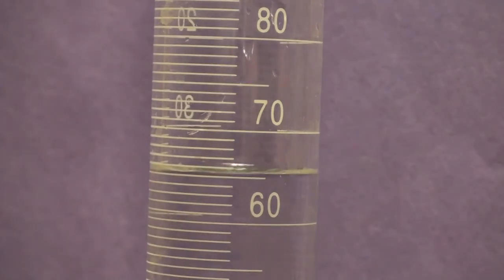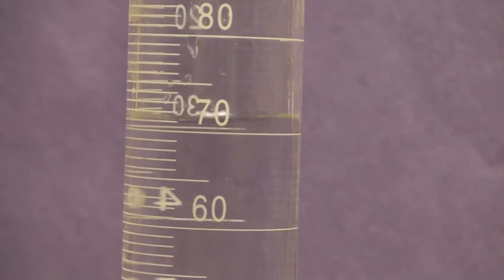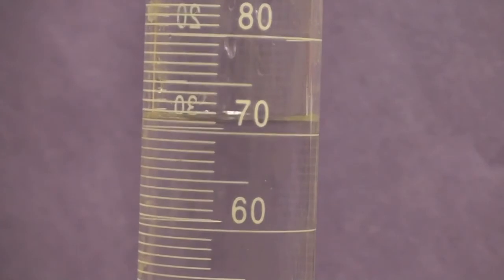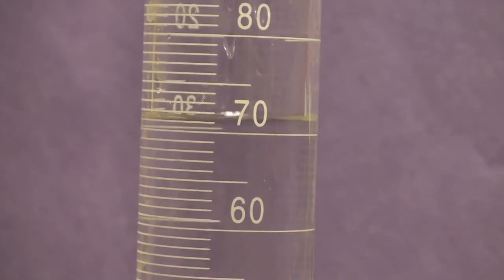I'm now going to take that graduated cylinder and tilt it and slide the piece of lead in it. I'm going to do that to protect the graduated cylinder so I don't drop something heavy in it. So I'm very slowly just sliding the piece of lead down. And what we should see is a change in the water level. And you want to record the new water level on that graduated cylinder. I'm moving it just a little bit so you can see it. Then I'll let it stabilize there. Okay, this is the final volume of the water level containing the lead in the graduated cylinder. So that should give us all the information that we need now to calculate our densities.